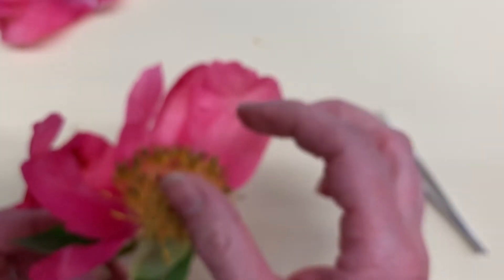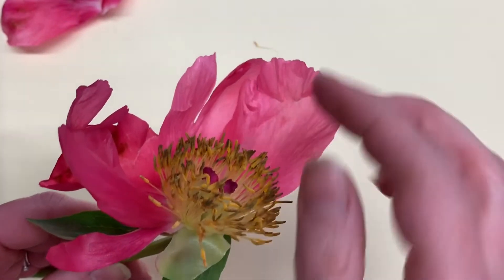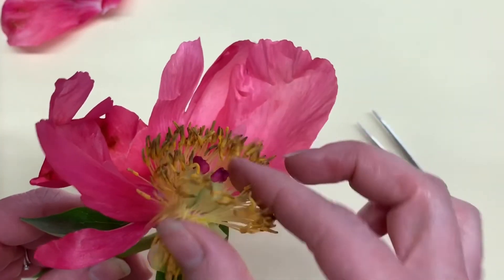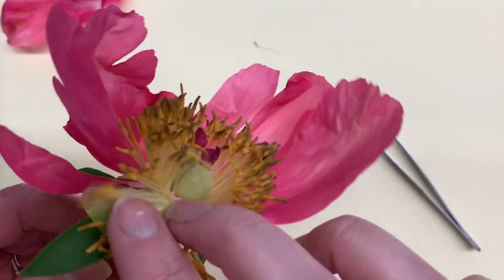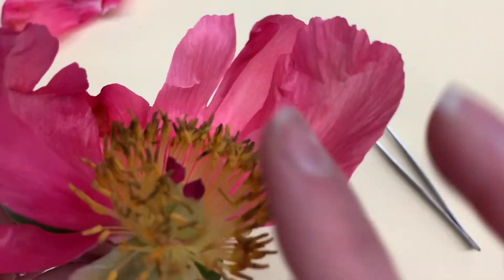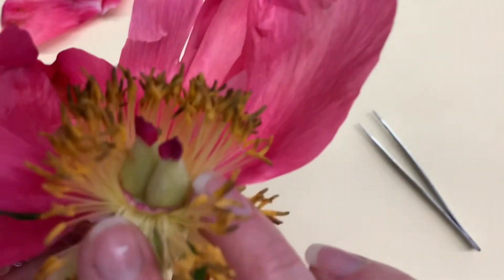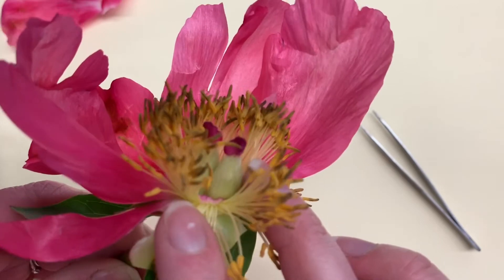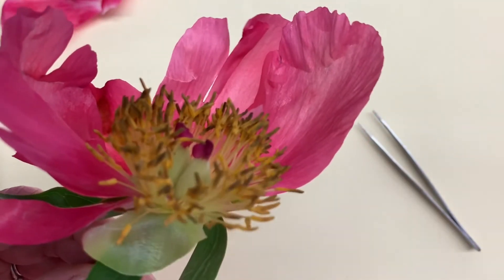What's very nice about peonies is that they have these really, really big pistils right in the middle. You can see the pistils there.